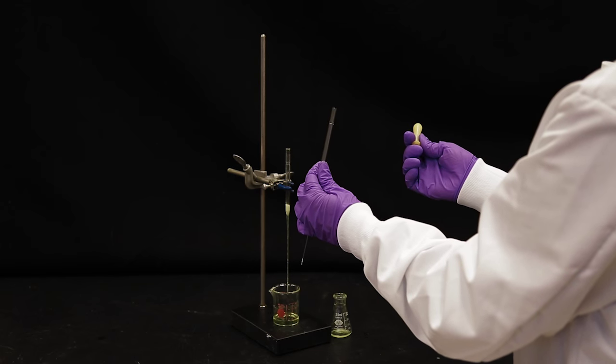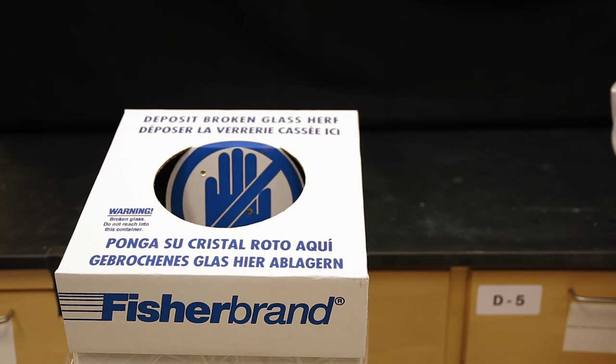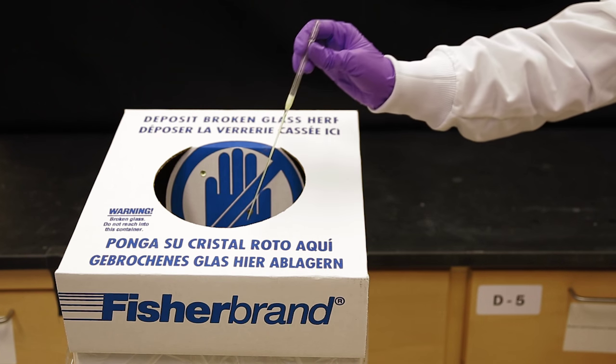Remove the bulb from the pipette. Then dispose of the pipette and the Pasteur pipette filter in the containers provided for glass collection.